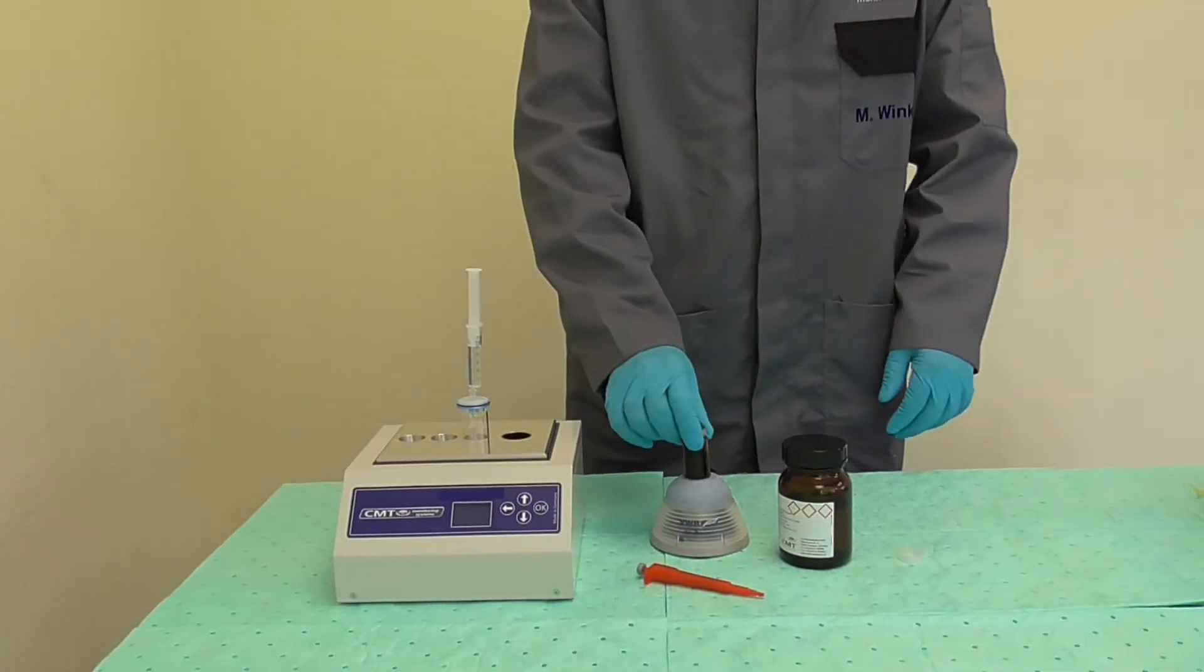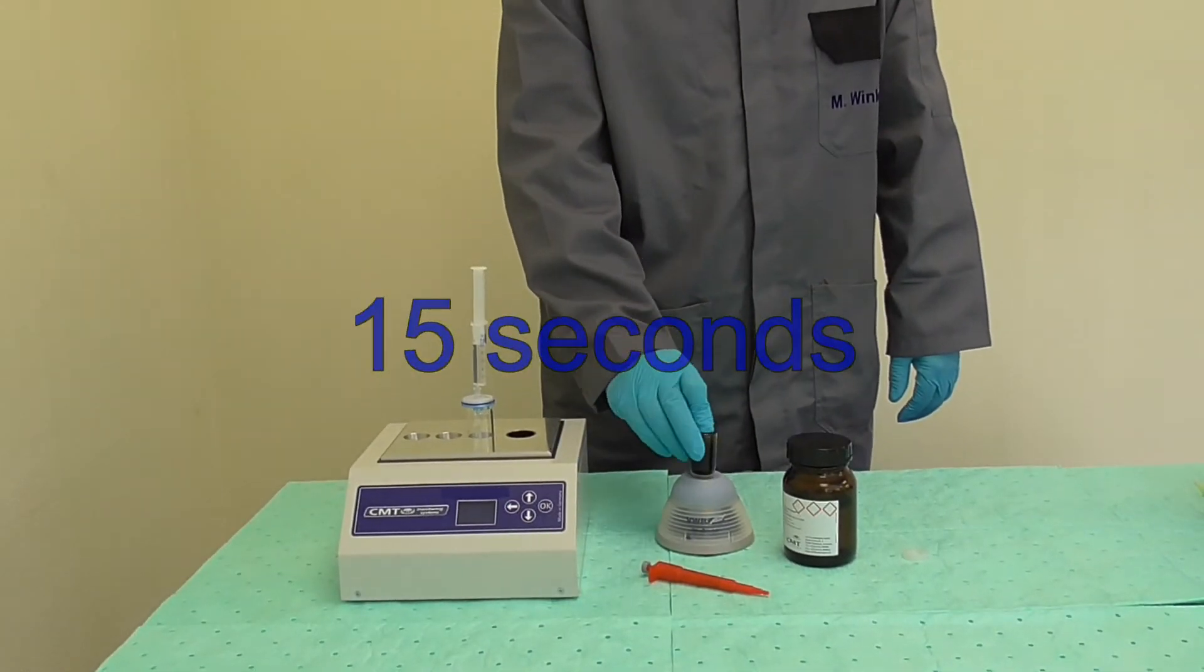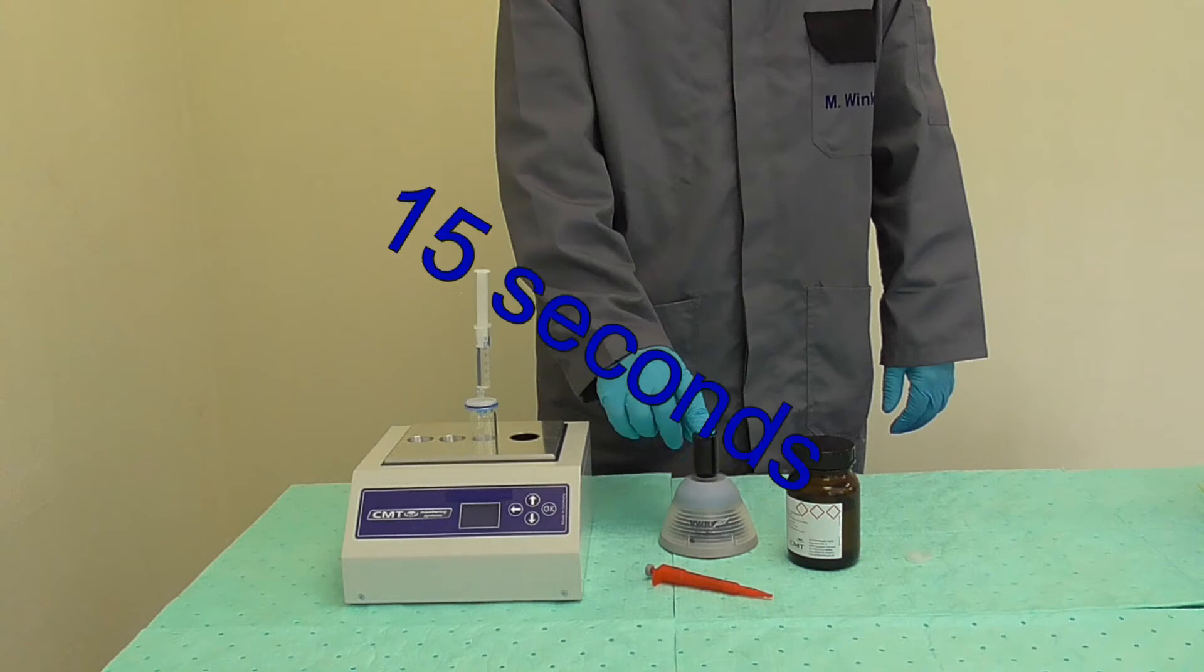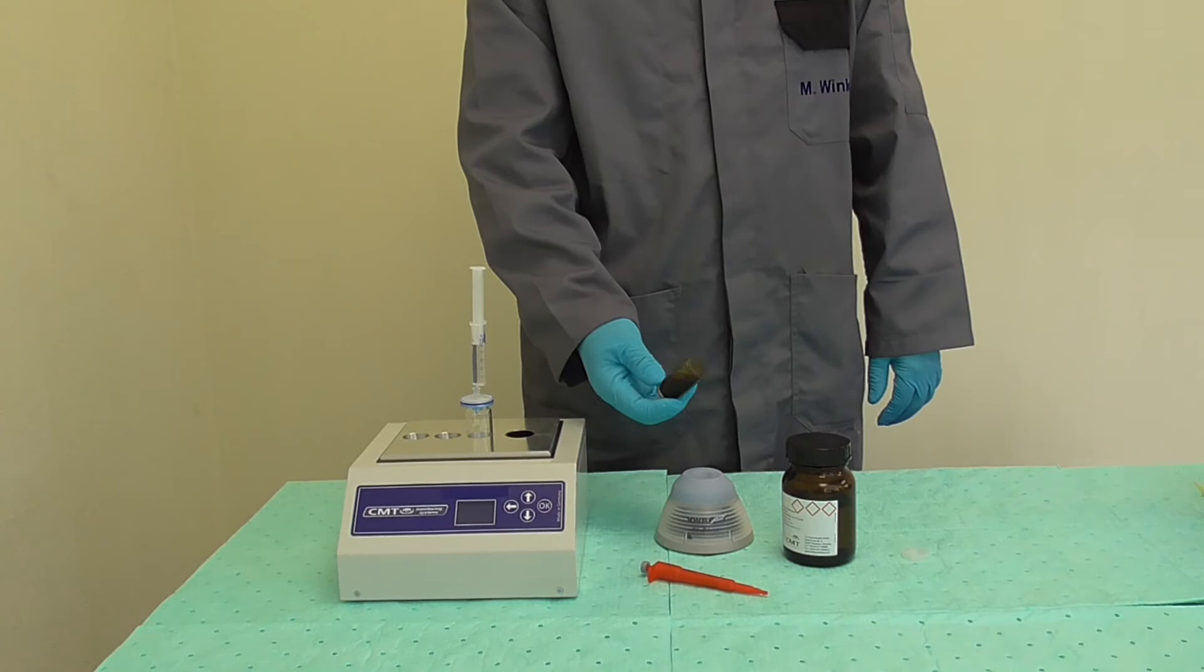Now take vial number one and shake it again from both sides for about 15 seconds. Check again that its content is well mixed.